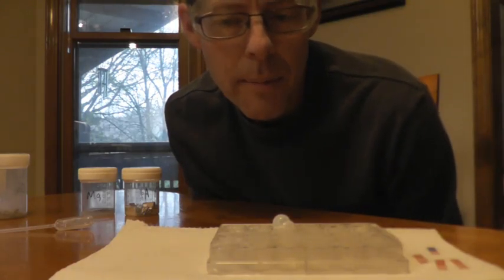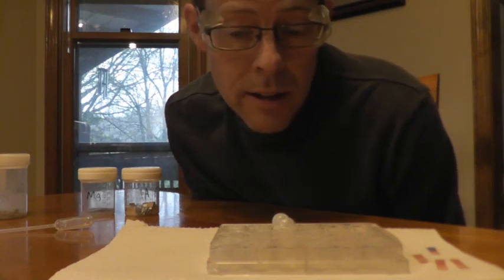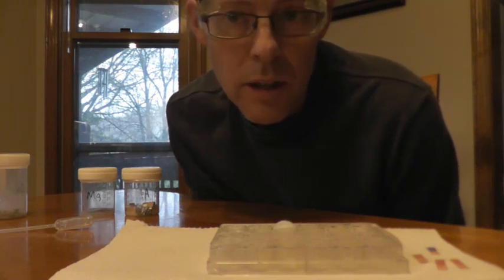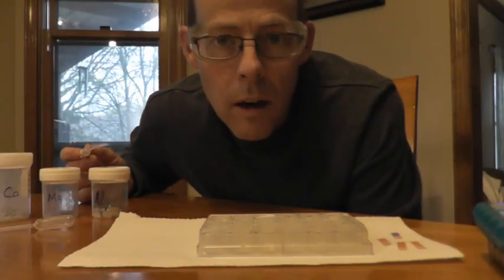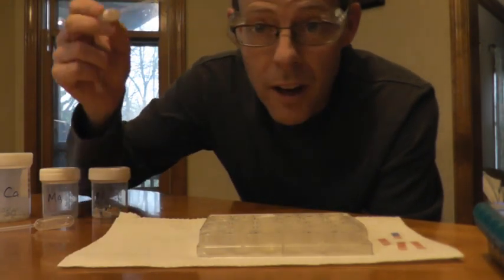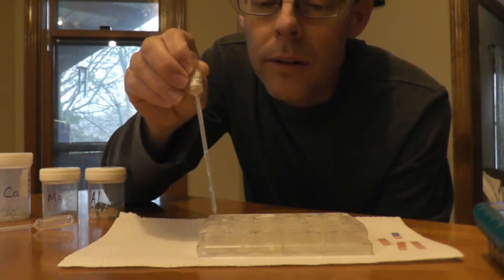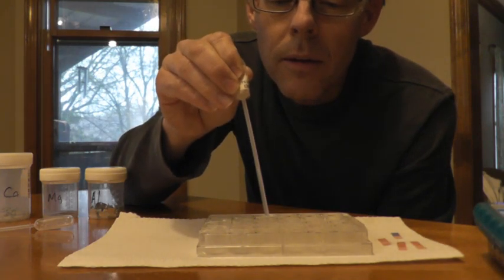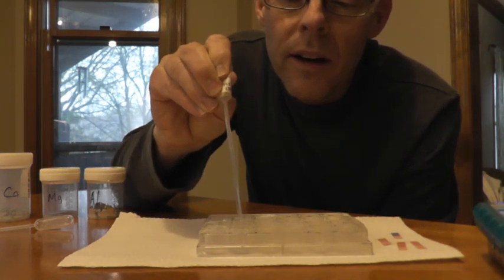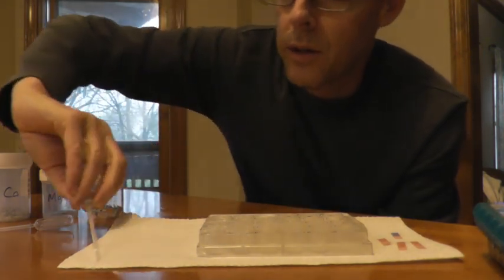And I'm going to stop the video right now, set up another one where instead of using water, we're going to use hydrochloric acid and do the same thing, and use a temperature probe to see what happens to the temperature of each of these things as we put them in hydrochloric acid. Alright, so part 2 of the lab. Just kind of mentioned to you, we're going to do hydrochloric acid in 3 wells. Otherwise, we're going to keep everything else the same. And hopefully I've got enough. Good enough.